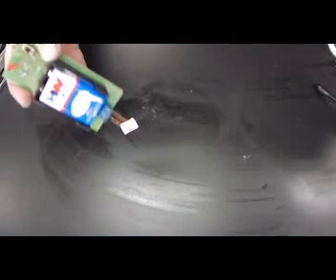The last thing we want to do, does it conduct electricity? All right, let's use our conductivity meter. And once again, we see that our light goes on. It does conduct electricity. Okay. All right, our next one we're going to look at is iodine.